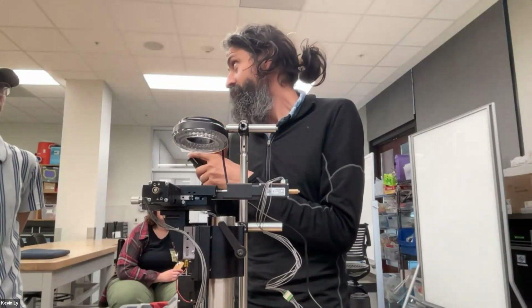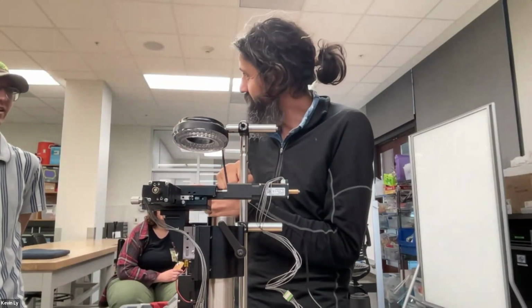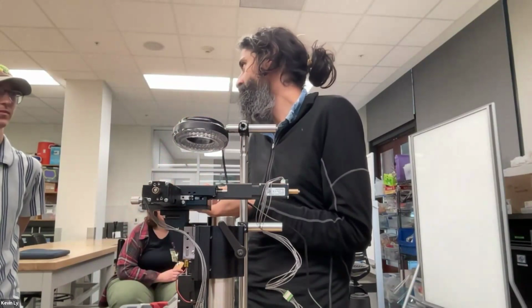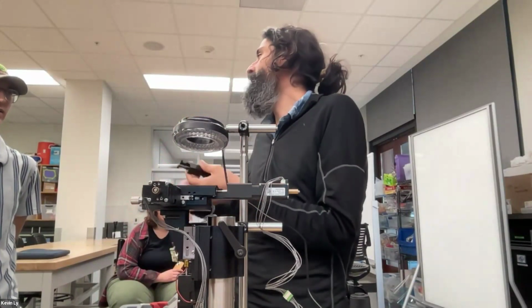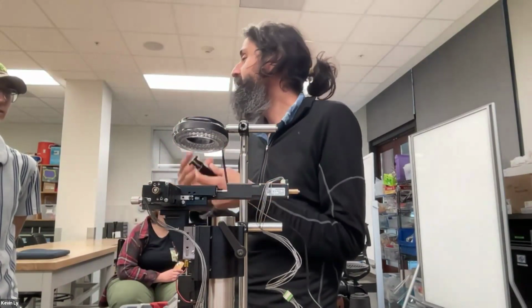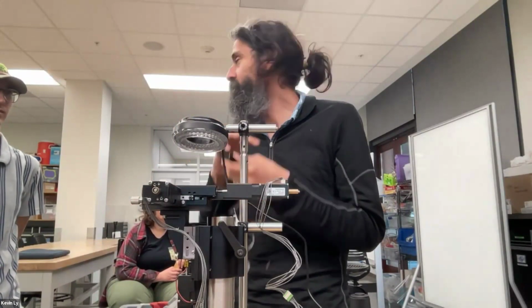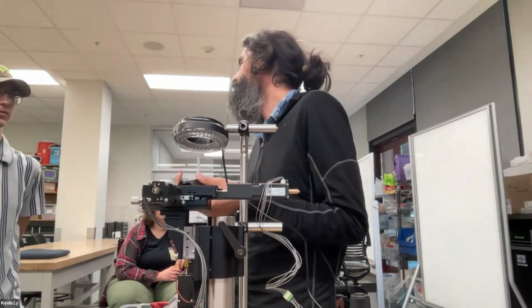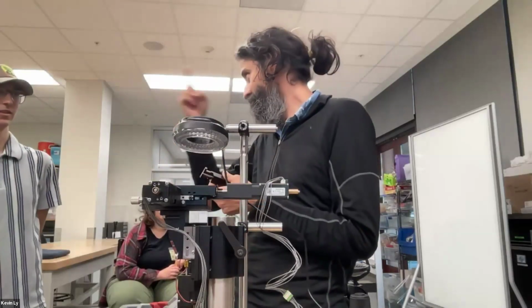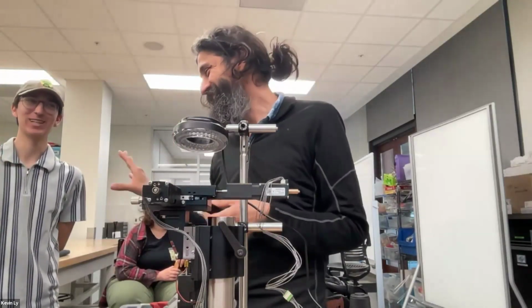Gotcha. You said piezos are cheap? I thought piezos were expensive. Piezos are super cheap. It's the controller for the piezo that's expensive. Really? It's just this strange thing. I can buy piezo material for 10 cents. But it's the electronics, and it's high voltage electronics. And actually, this has been another hidden secret that it's not so hard. There are lots of open source drivers. It's just high voltage. So companies have sort of made this a not-free product.